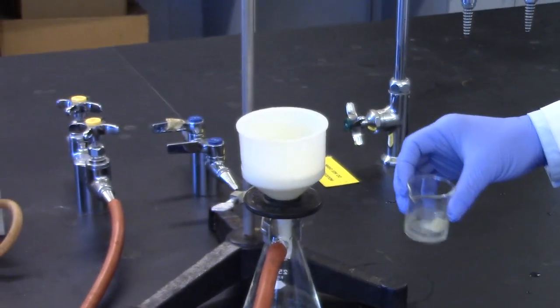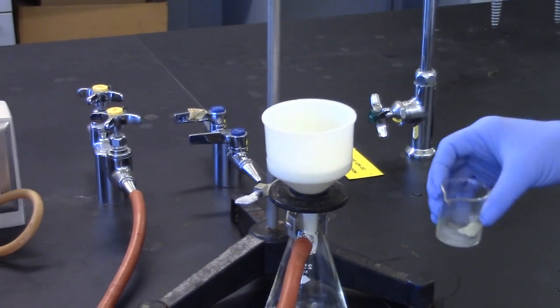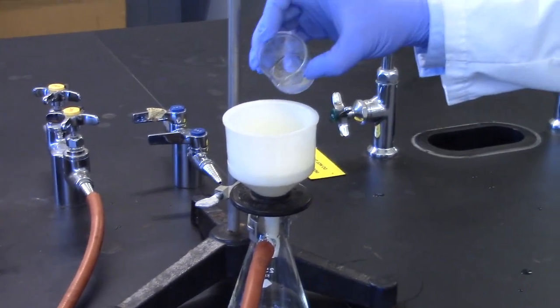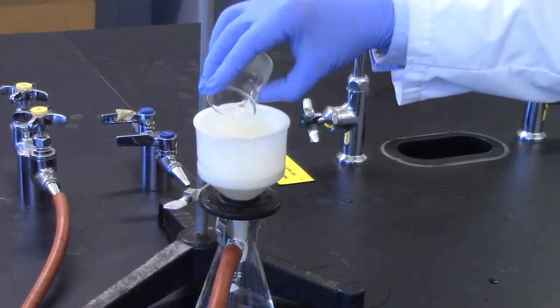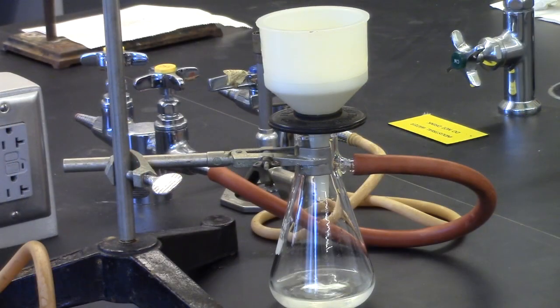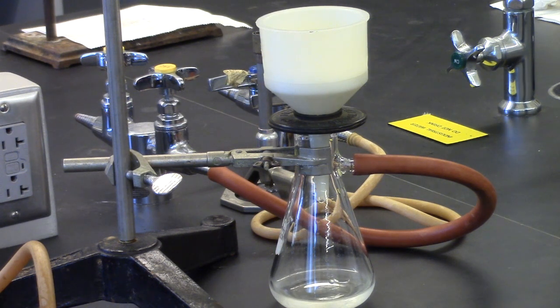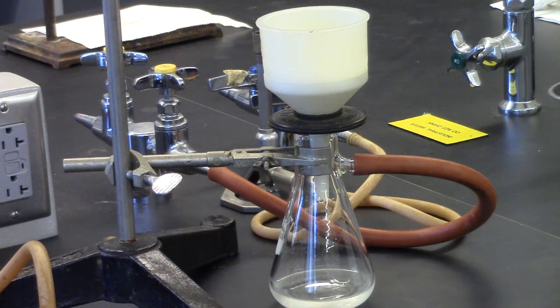Prepare a rinse by adding a chunk of dry ice to about 5 milliliters of water in a 50 ml beaker. When it is ice cold, pour carefully over the baking soda.